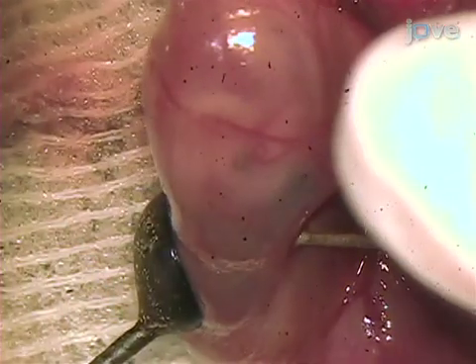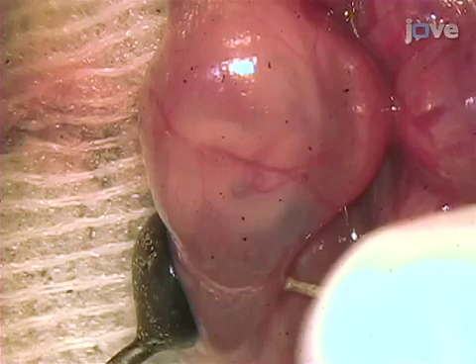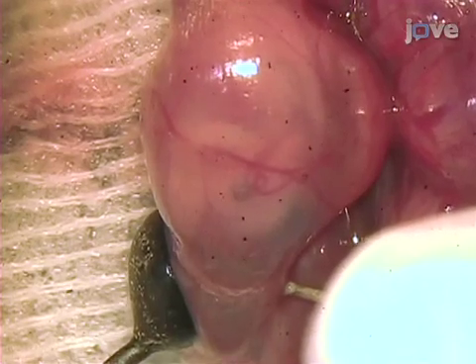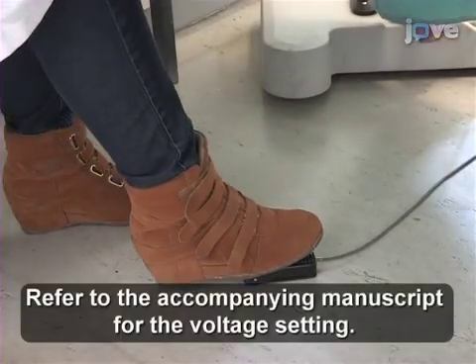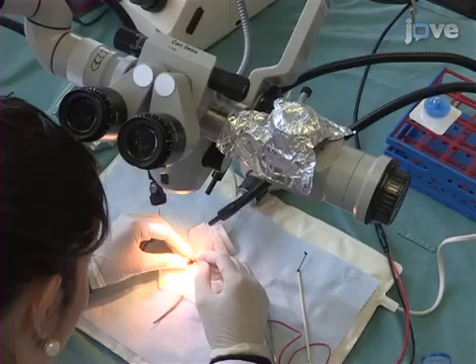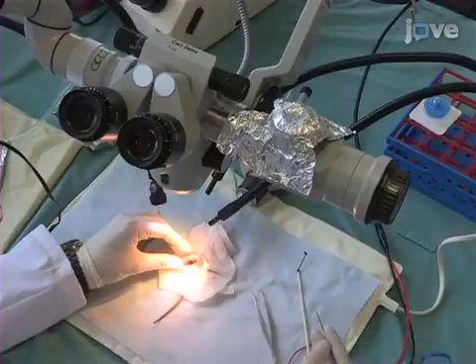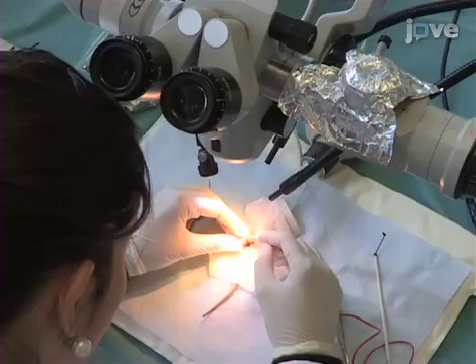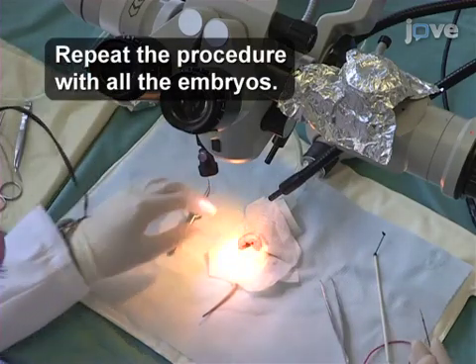Position the round flat electrode outside the uterus wall on the opposite side of the embryo's head with the other hand. Then gently squeeze the embryo between the electrodes and use the pedal switch to apply voltage. After that, slowly pull the needle electrode out of the uterus while holding back the uterus with the index finger of the other hand. If amniotic liquid is lost through the punctured wall, usually the embryo will undergo abortion.